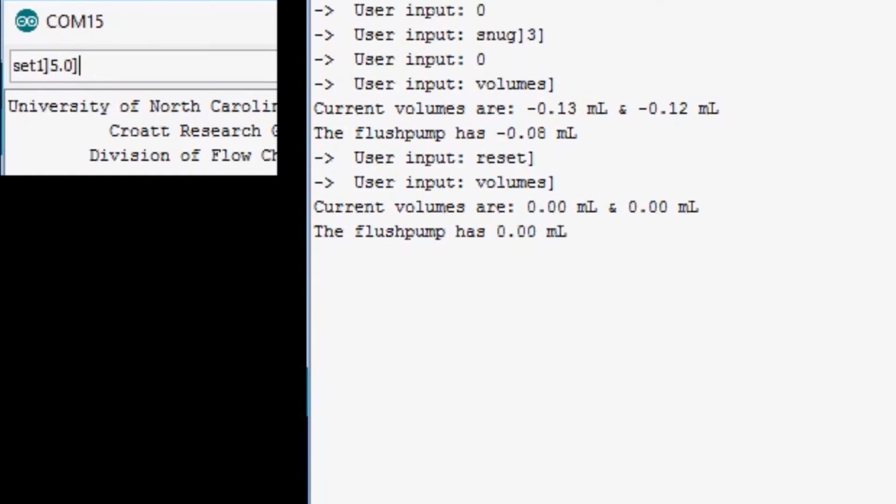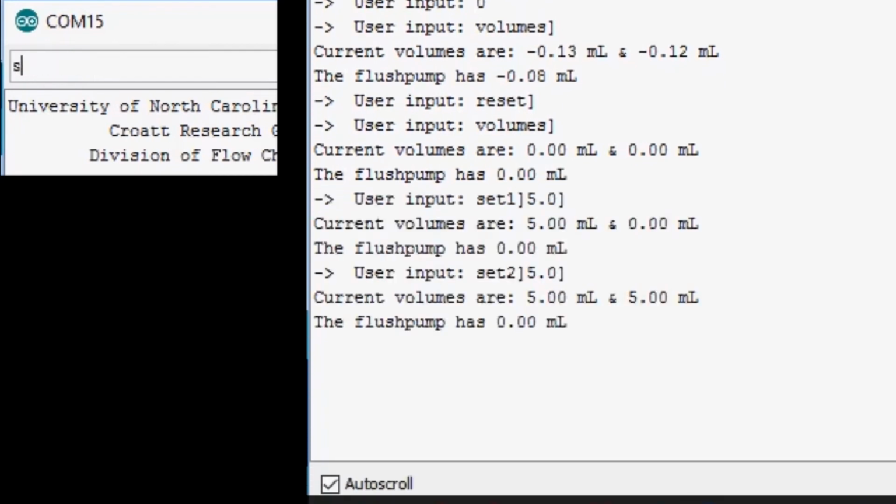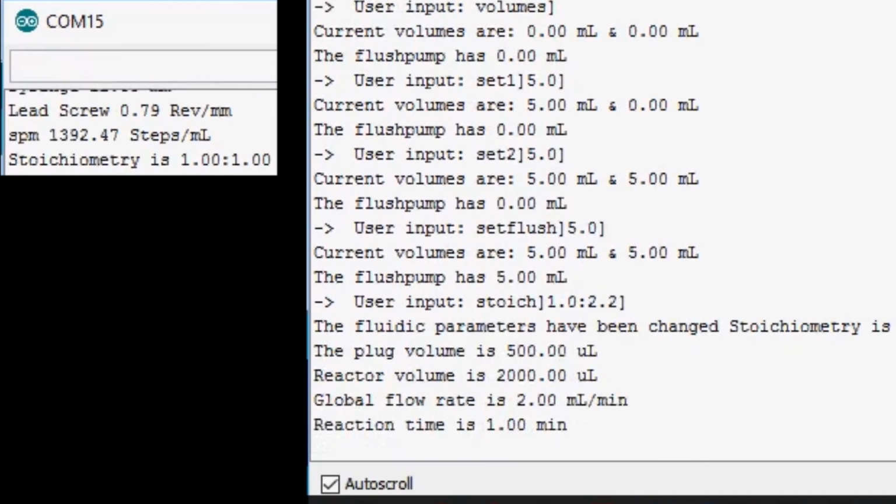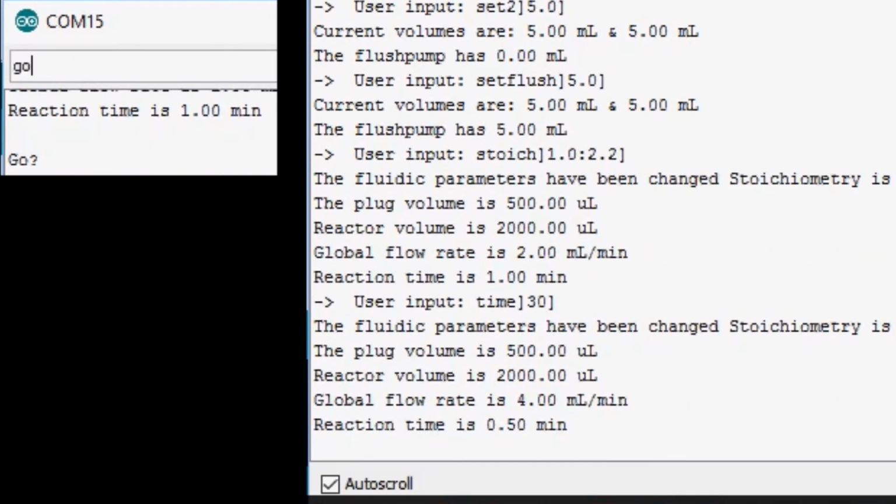Let's assume in this experiment that all 3 syringes are filled to the 5 milliliter mark. The next step is to set the relative rates of the reagents using stoich. In this case, I'll use a 1 to 2.2 ratio. Don't forget to use a colon mark between the numbers. The default reaction time is 1 minute. Let's change that to 30 seconds using the time command. Now we can start the experiment by passing the go command to the microcontroller.